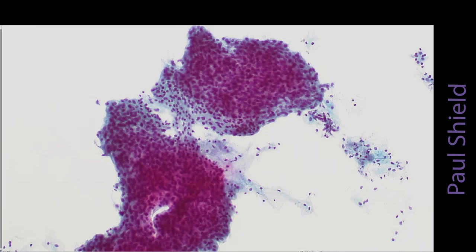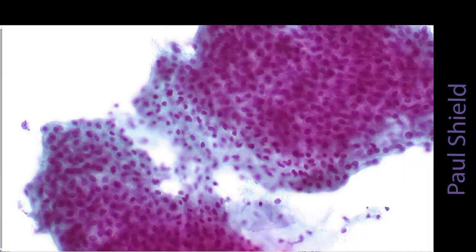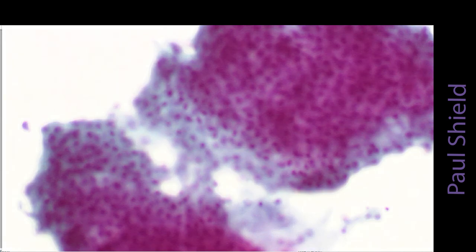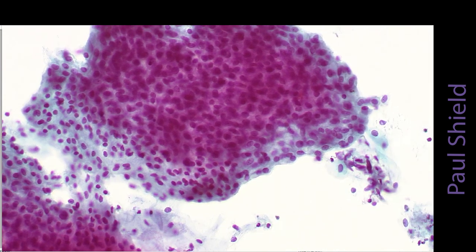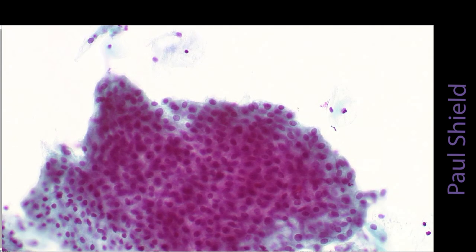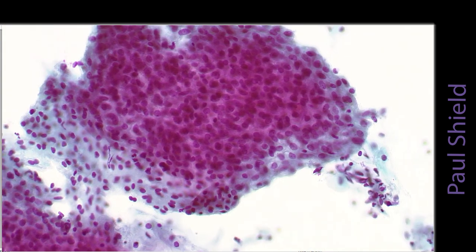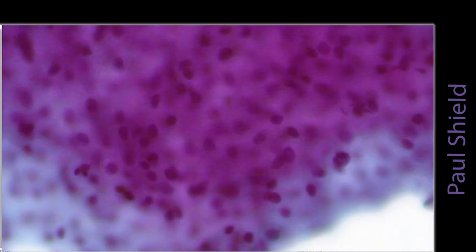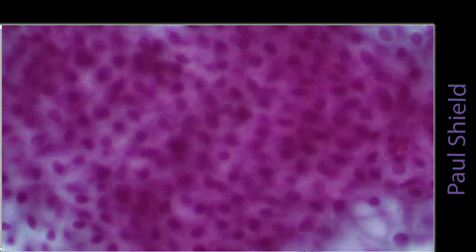This is probably a harder example. This is atrophy as well, and these are quite hyperchromatic looking groups of parabasal cells. In this case you can see, especially around the edge, the nuclei are quite well spaced, so that reflects the fact that they have an adequate amount of cytoplasm. The NC ratio is not too high. And if we look on higher power, you can see there is pretty good organization in here.